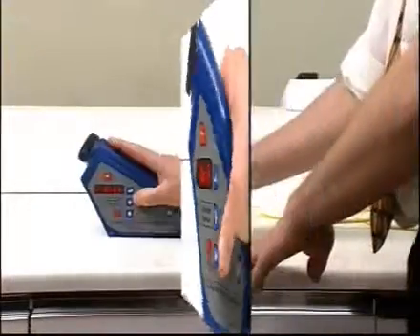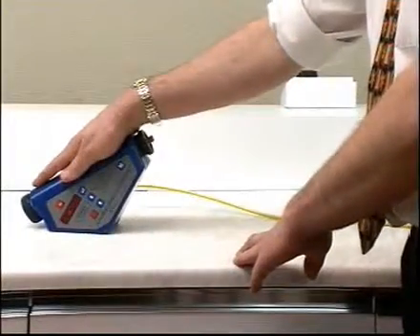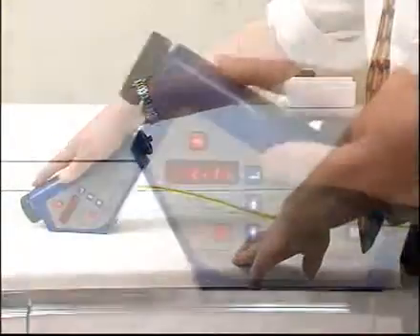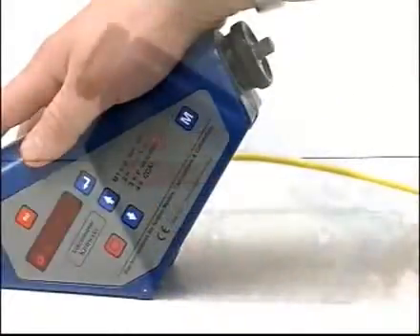To improve accuracy, take several readings over a longer period of time until the readings stabilize.